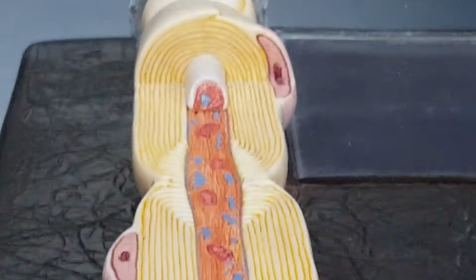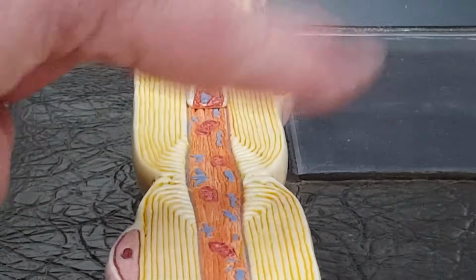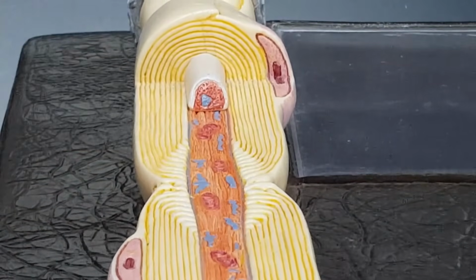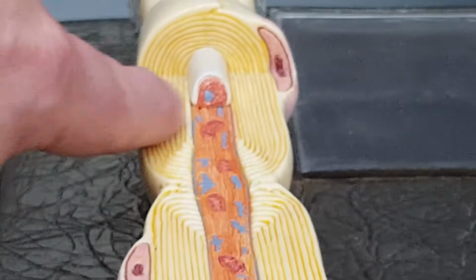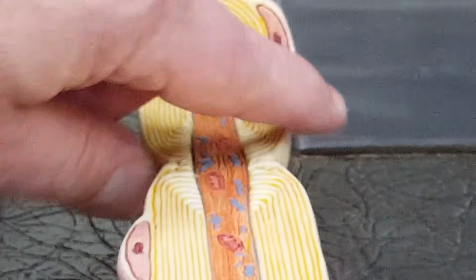I'm going to try to tilt this without actually striking the camera. There we go. They wrap around the axon of this cell multiple times, around and around and around, like paper around a cardboard tube for paper towels, if you can find some paper towels, which they're available now. But see all these layers of cell membrane, which is mostly what? Phospholipids. That serves to insulate this cell.